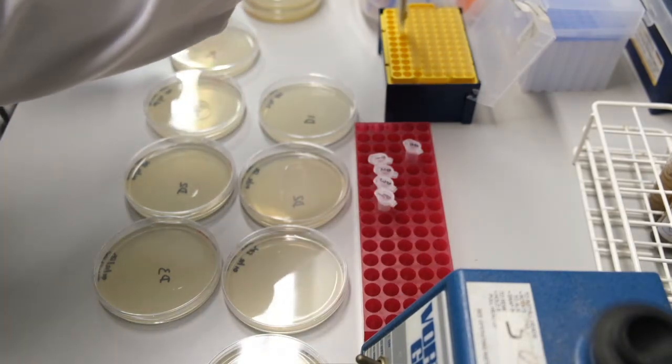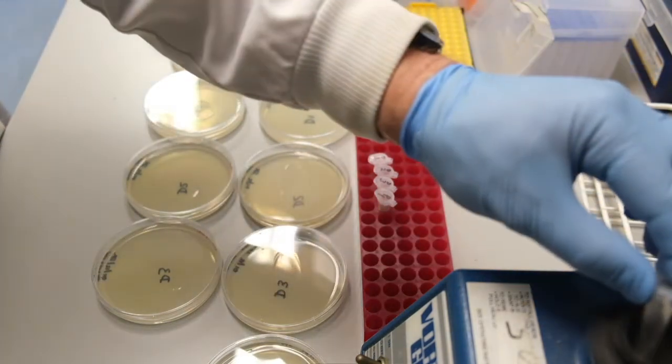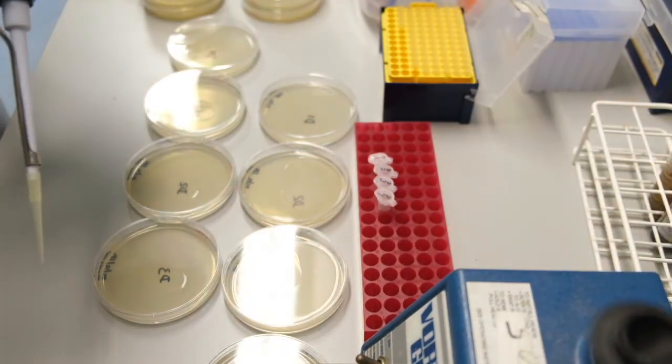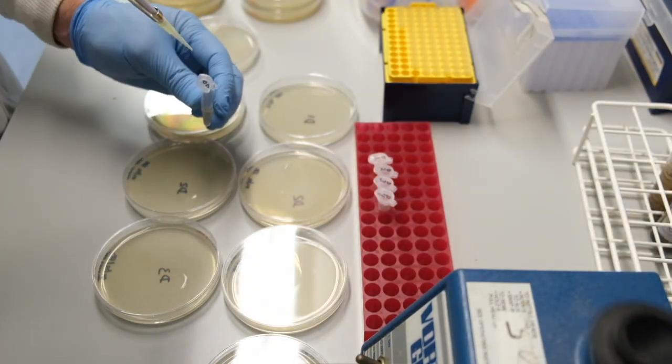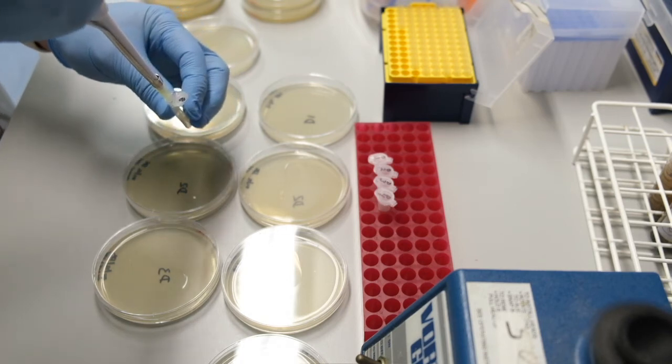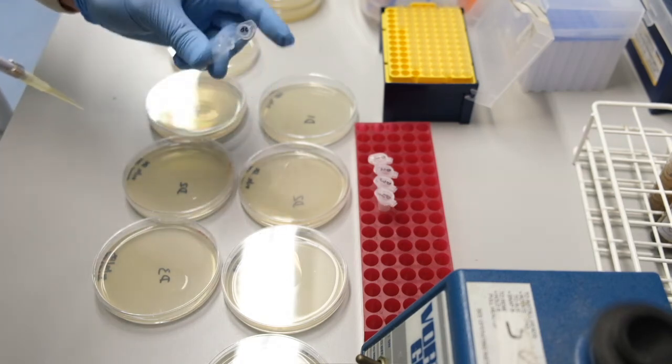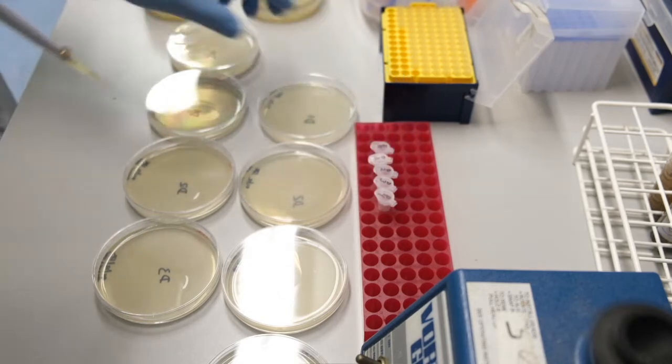Remember, the 10 to the minus 4 dilution was spread only on a plate with no nalidixic acid. We will spread the undiluted cells only on a plate with nalidixic acid.